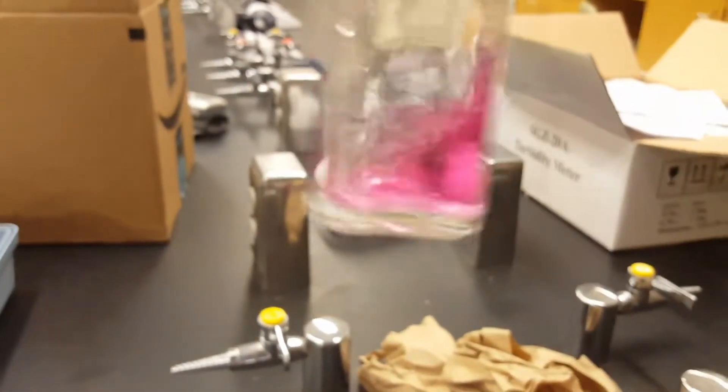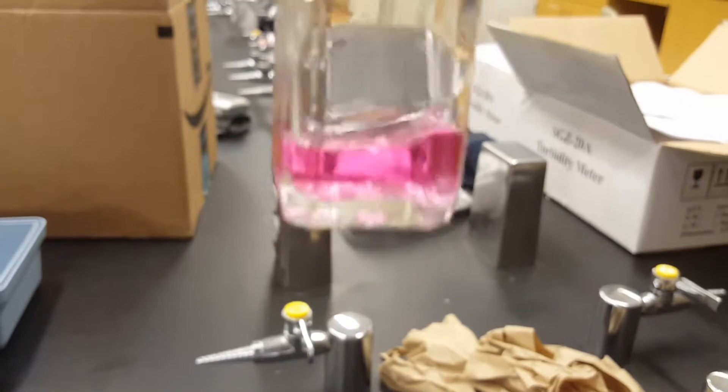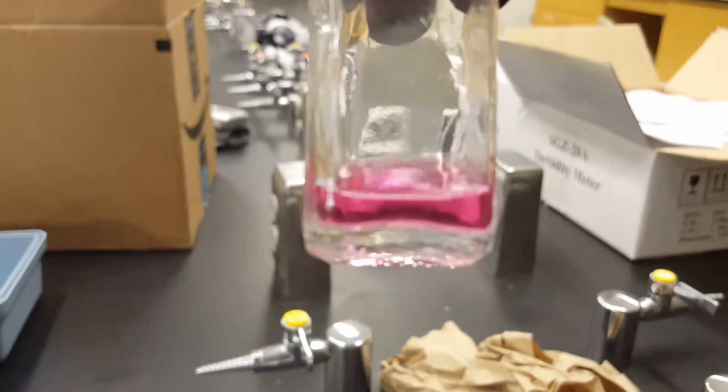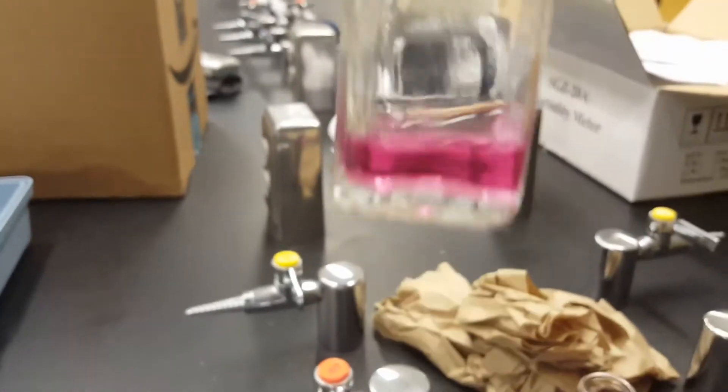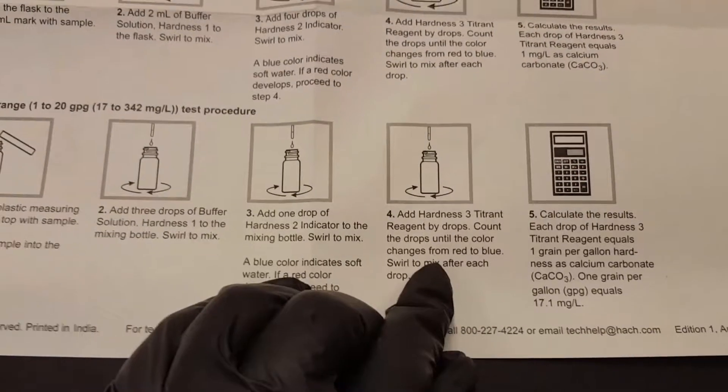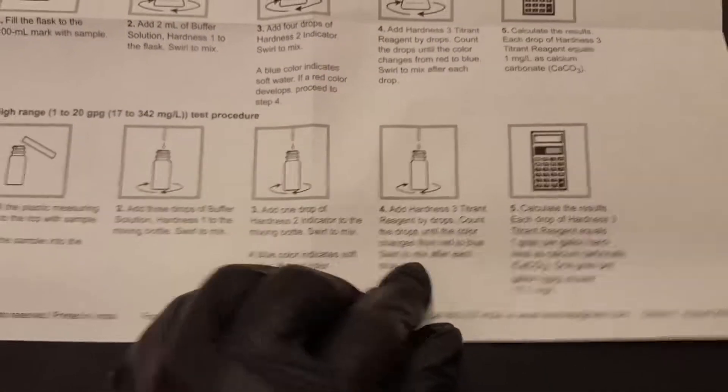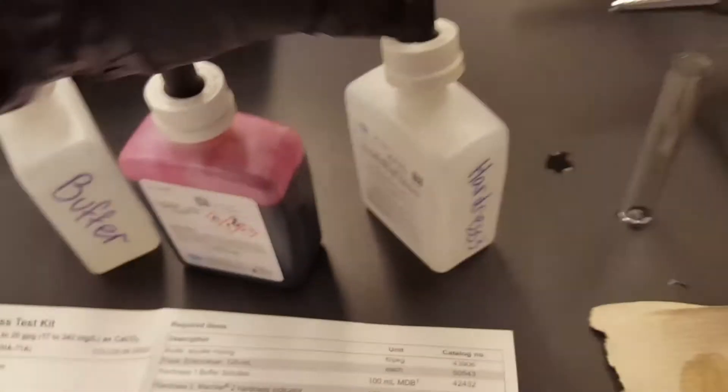So swirl it around and it turns pink. Pink means we have hard water. If this were blue it would mean we have soft water.